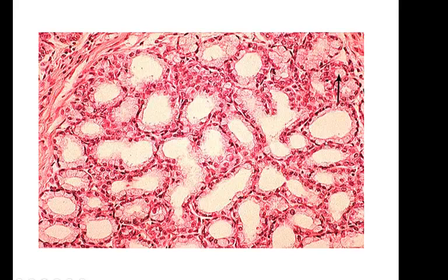All these rows here, everywhere where I'm going around like this, what they have done is they have cut through tubules. They've taken cross-section through tubules in the kidney. Also in the kidney, we not only have simple squamous epithelium, we also have these types of cells, and these cells are more cuboidal shaped. This is simple cuboidal epithelium.